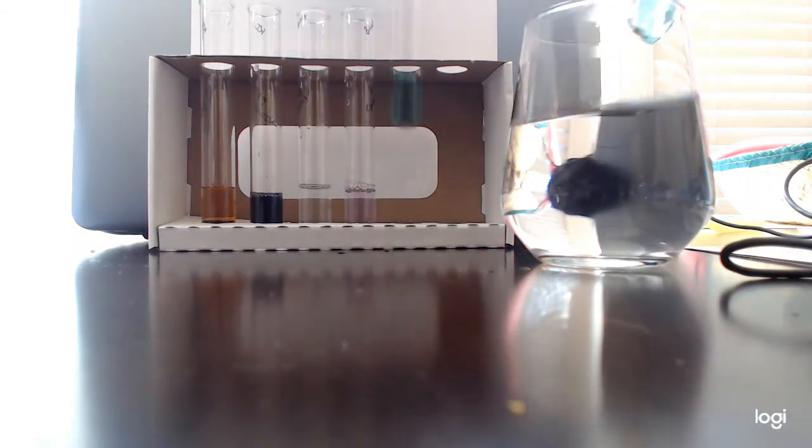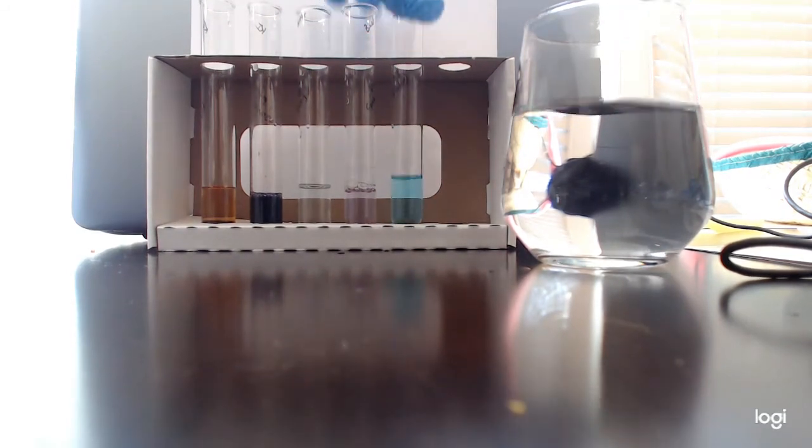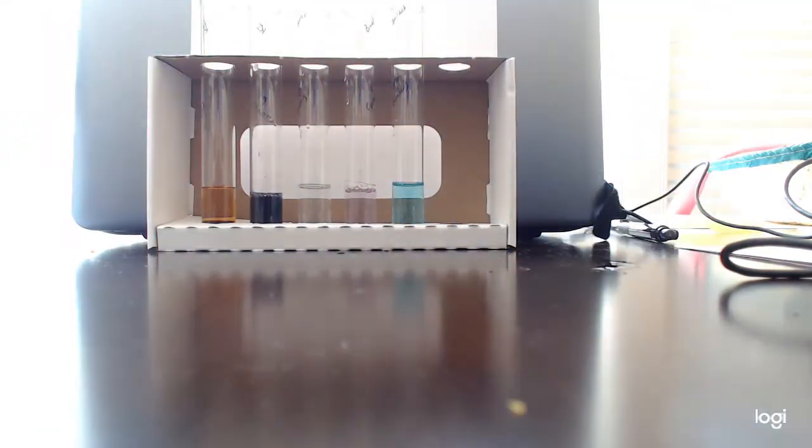All right, let's see how we're doing. Okay. Let's get some hotter water.